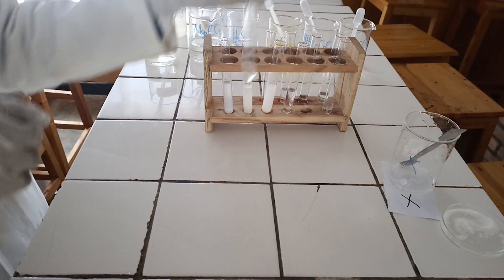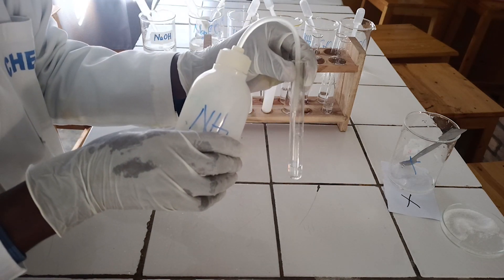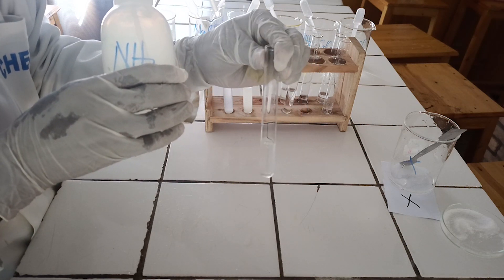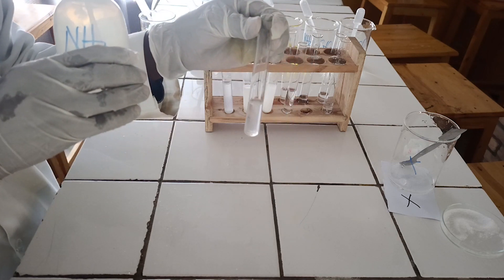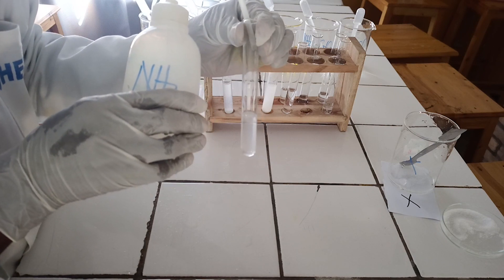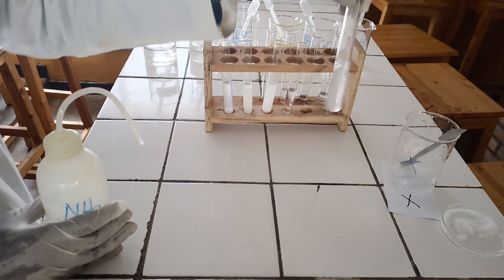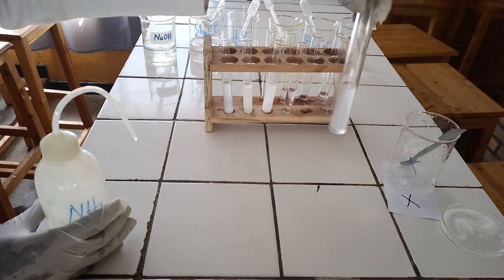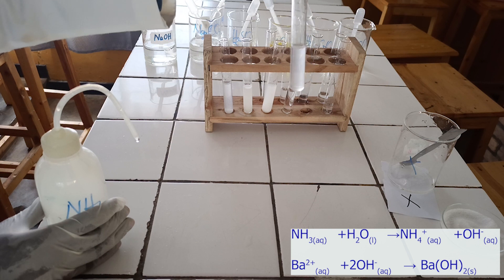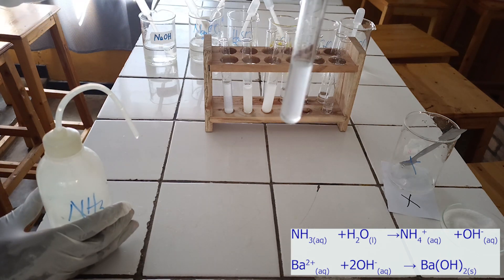To the fifth test tube, add ammonia solution dropwise until in excess. As you see, ammonia reacts with barium ion to form a white precipitate, which is insoluble in excess of ammonia. Below, there is the ionic equation for this reaction.